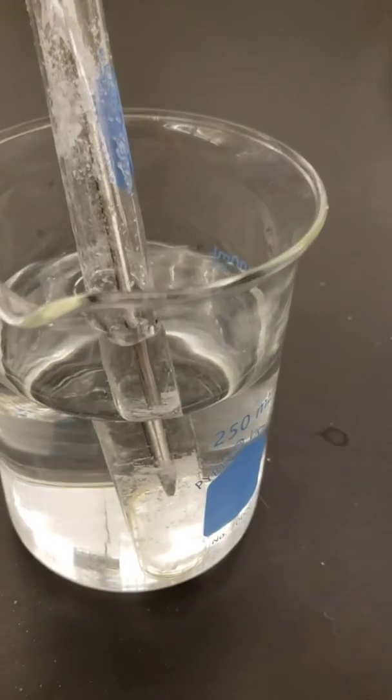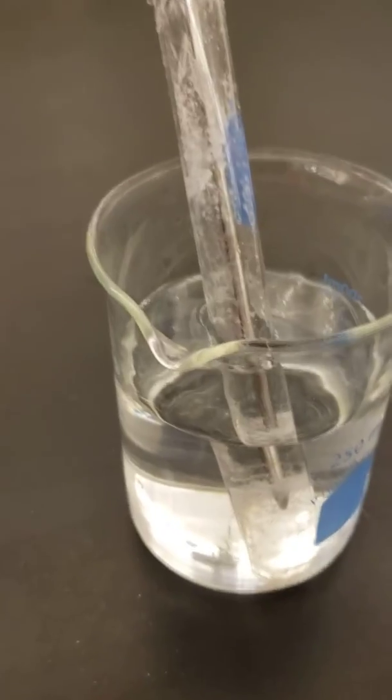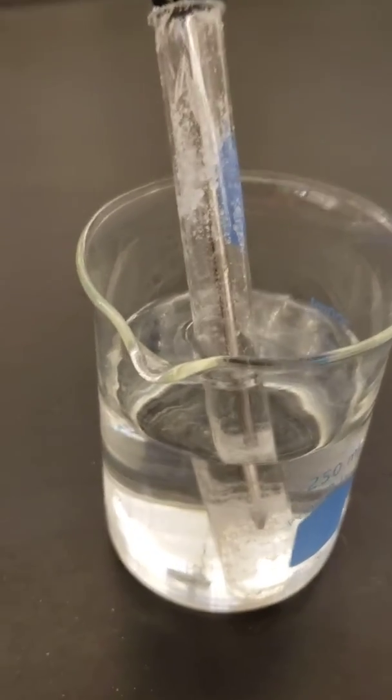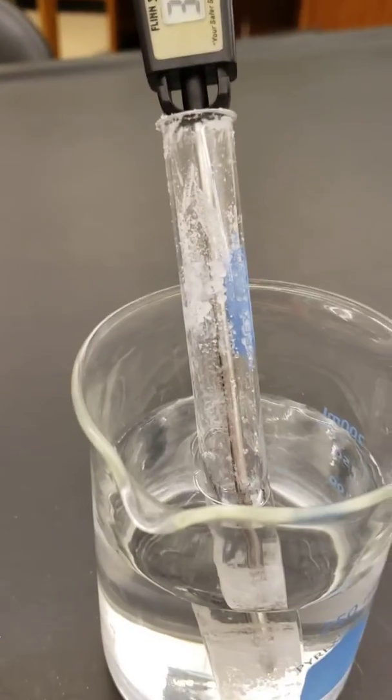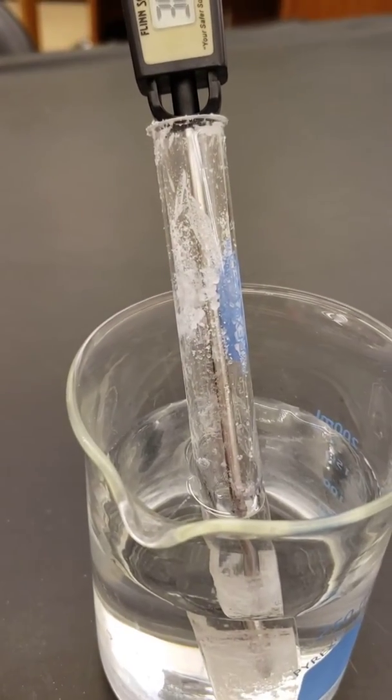See, you can see some crystals starting to form on the side there. We have 40— a little hard to read there—48.3 was what I got. Sorry for the glare.